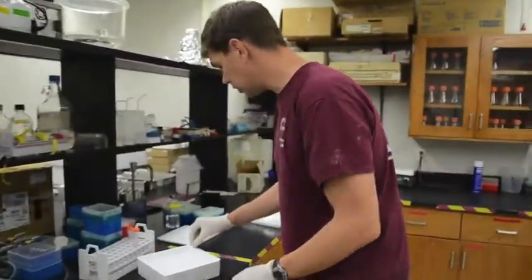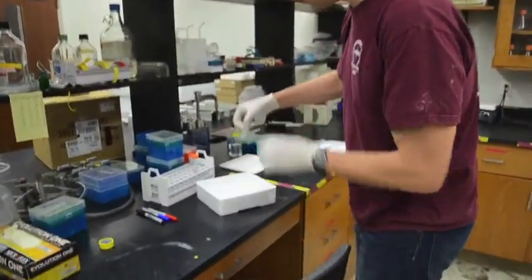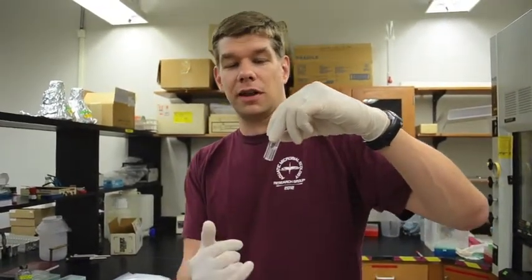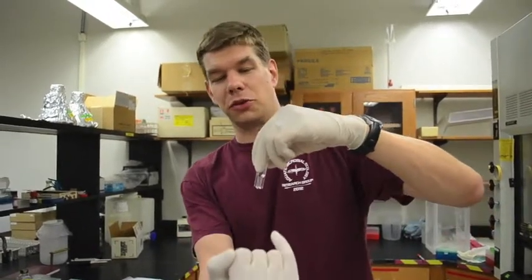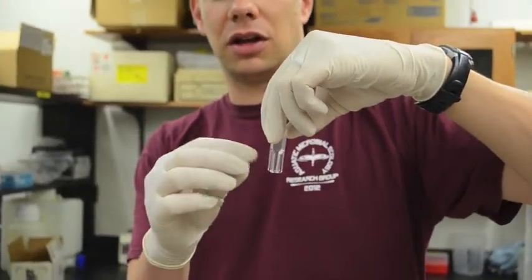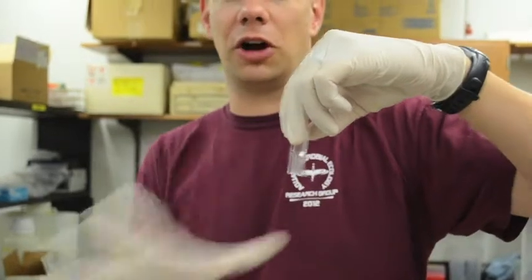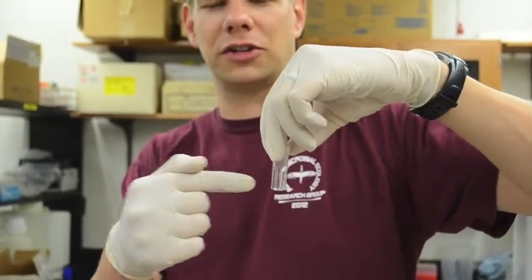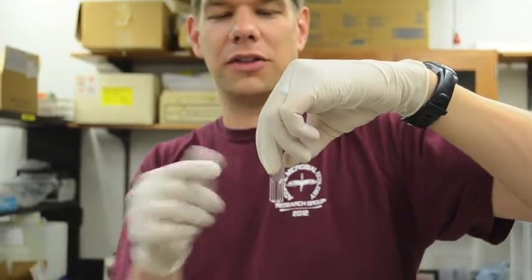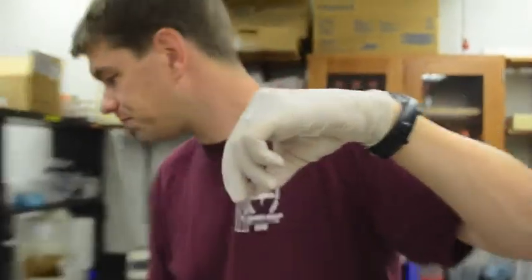So we're going to do the experiment in these little vials that are called cuvettes. The point of these vials is that they are transparent to ultraviolet light, which is being used to excite the fluorescence, and they're also transparent to all the visible ranges of light. So what's going to happen is the fluorimeter is going to shine a light in the front of this cuvette, and then the fluorophores are going to emit fluorescence in all directions, and then the fluorescence detector has a little electric eye, a little photodiode on the side that's collecting the light that goes out the side.